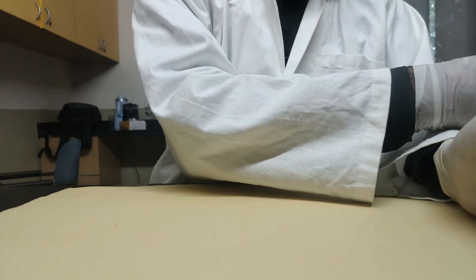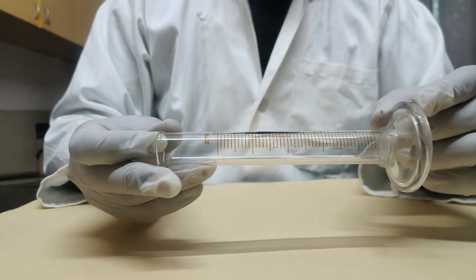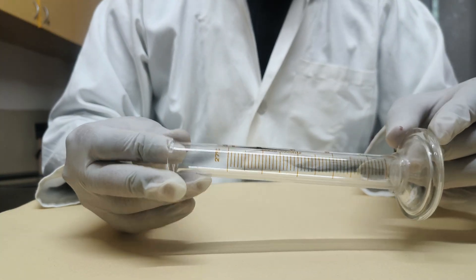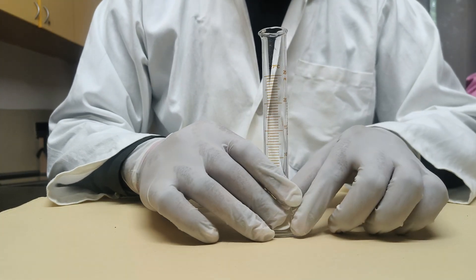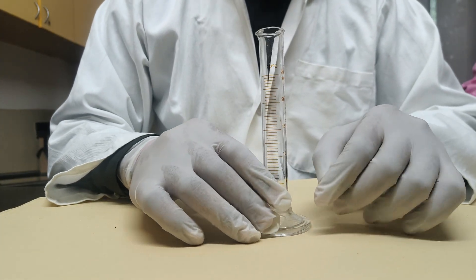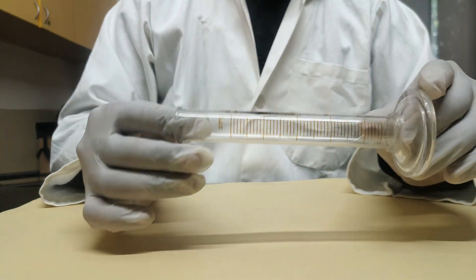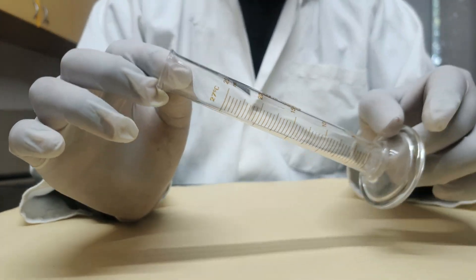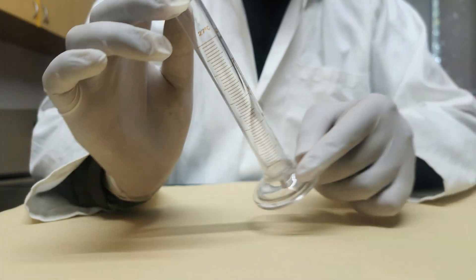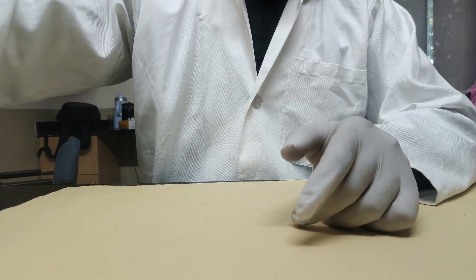Next item is the measuring cylinder — in IGCSE we call it a graduated cylinder. It is used to measure liquids in accurate amounts. As you can see, this one is 25 ml, and it comes in different sizes.